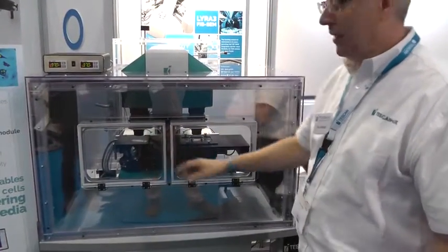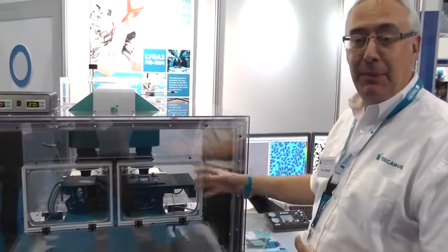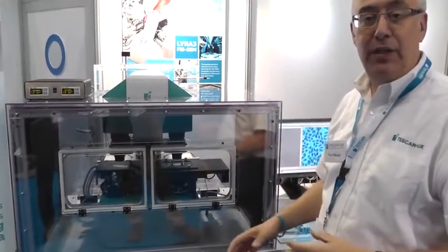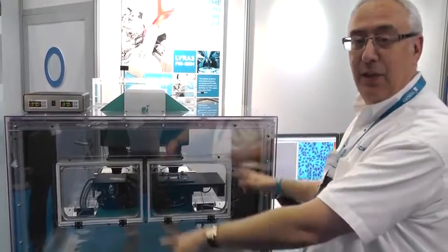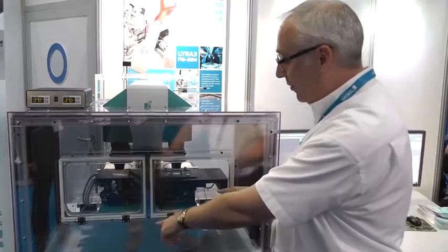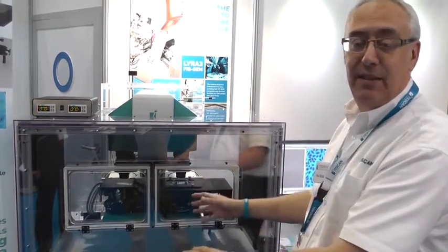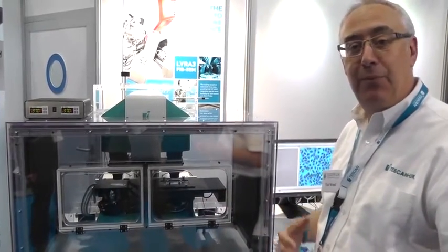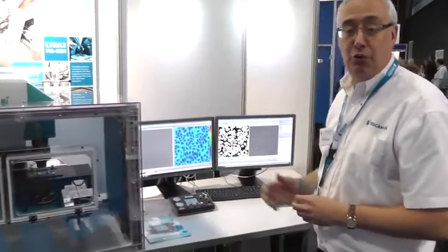a reference arm. The sample, we can put live cells in their medium that they're happy to live in, and on the reference arm we can have the medium, which will allow us to get an equivalent light path to come through the system and get recombined underneath the microscope with a patented system, which then creates the hologram output, which is then processed to give us our live cell imaging system in real time on the screens.